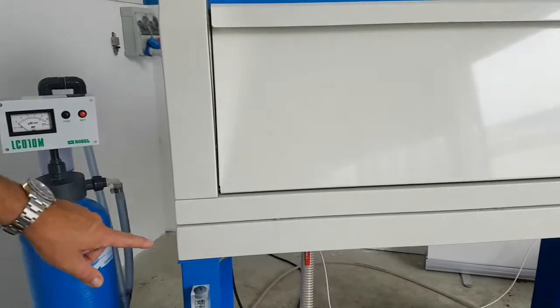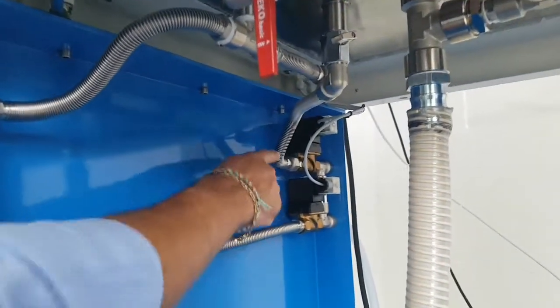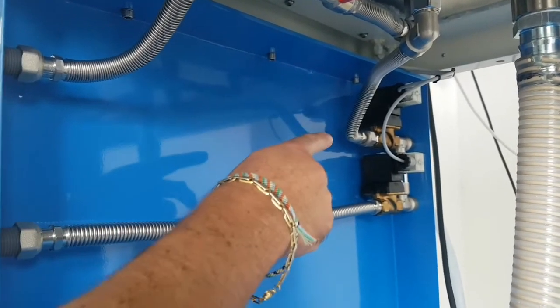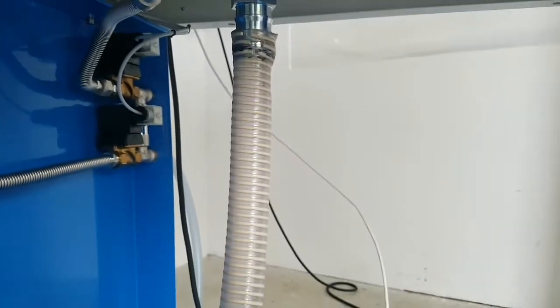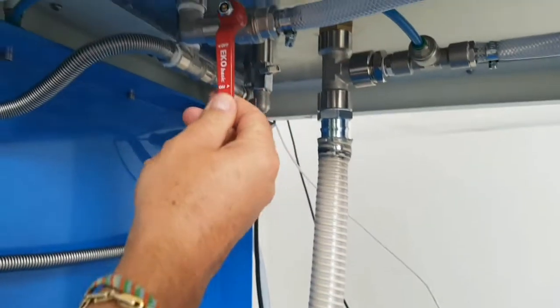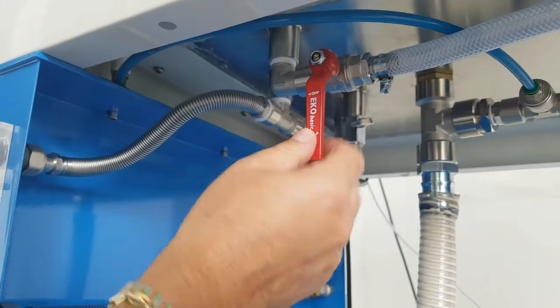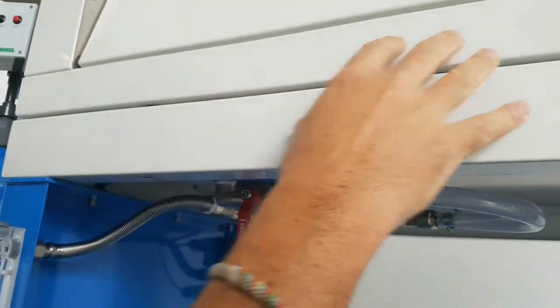In the bottom of the chamber you can see the two electrovalves for charging the water for condensing and for the spray. The drain tube must be connected to your drain system, and this is the tap for opening and closing the tank for the water, which is located here in this position.